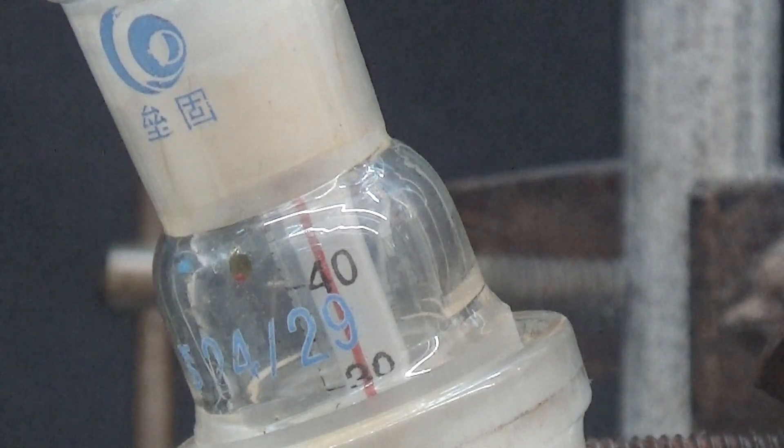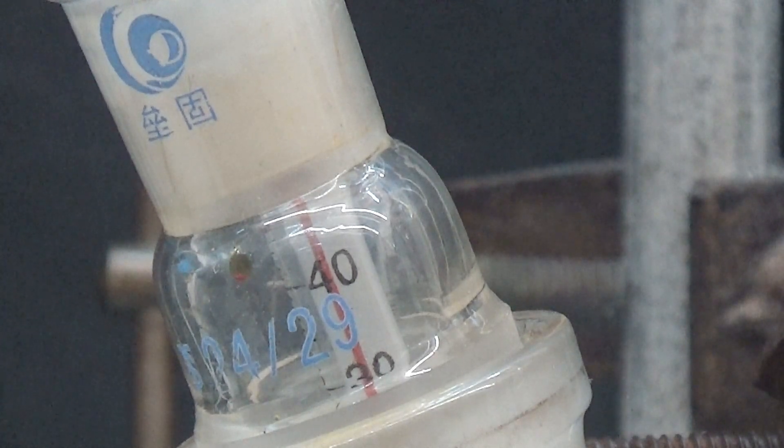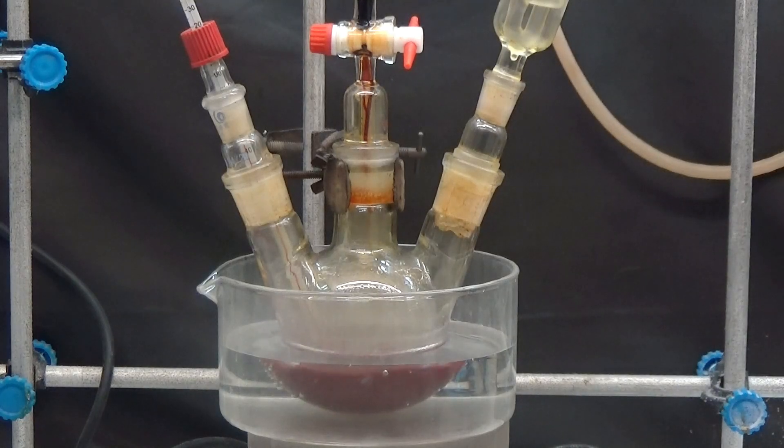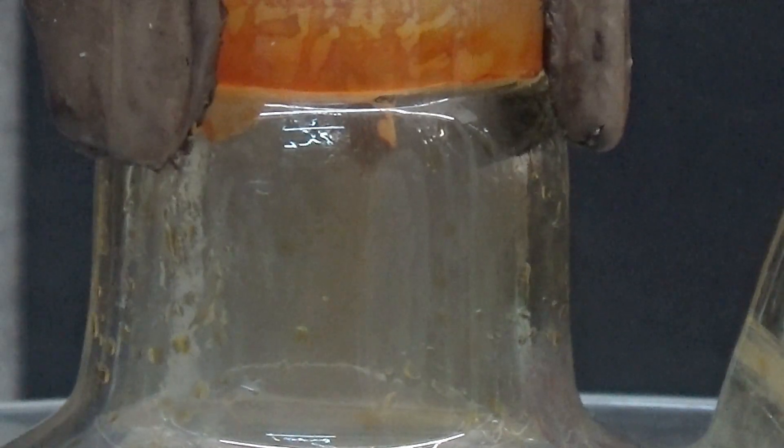It has been observed that the temperature increases rapidly to 50 degrees. We cool down with a water bath and continue adding bromine slowly.